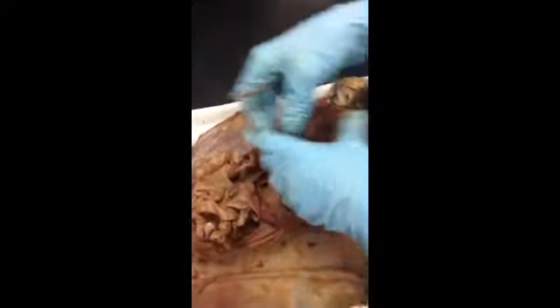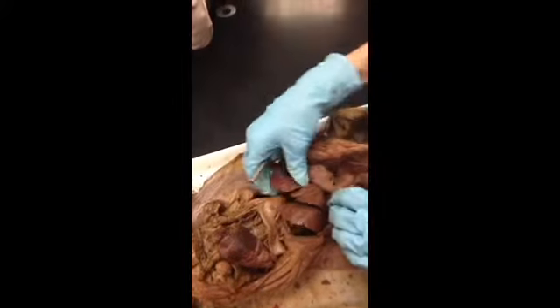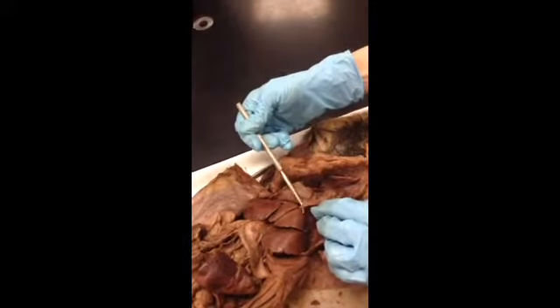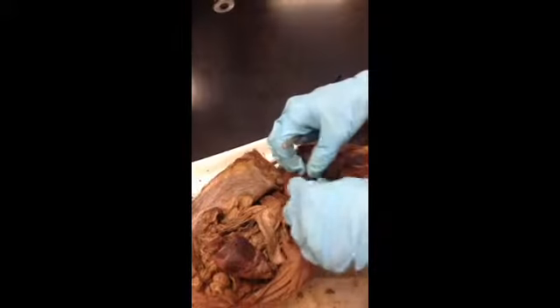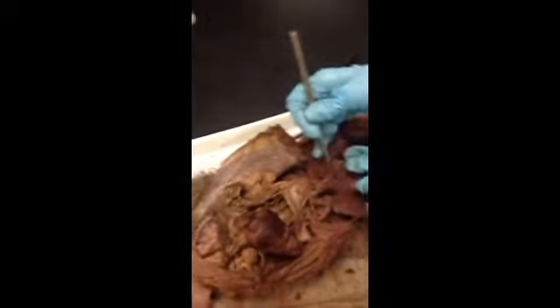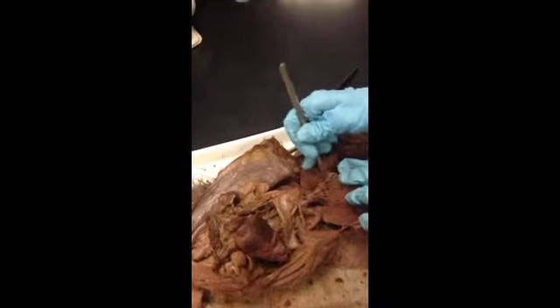And what else we have? We have liver. So again, here's our diaphragm. Here's our liver. That liver is actually held up against the diaphragm by this piece of tissue right here. That's called the falciform ligament. It just keeps that liver up here. And if we move this out a little bit, again, here's your gallbladder right there. And the gallbladder is going to deliver bile through the cystic duct. I don't know what all this goo is here.